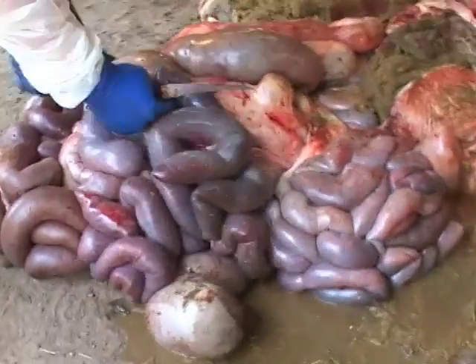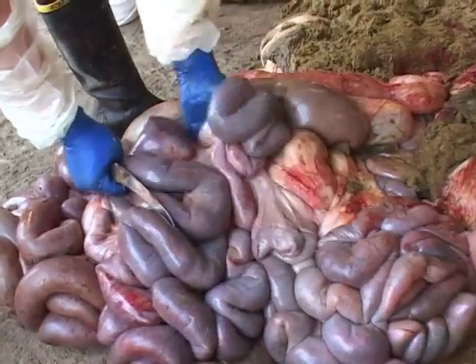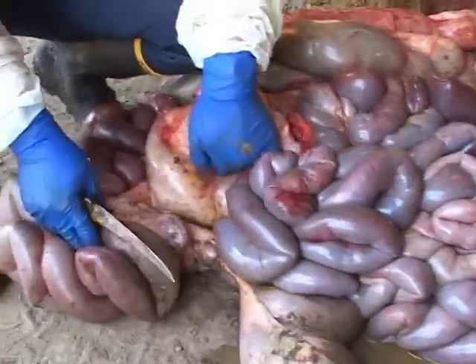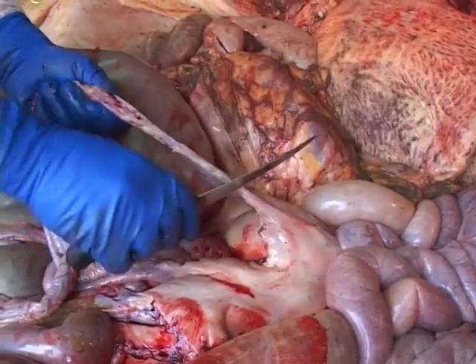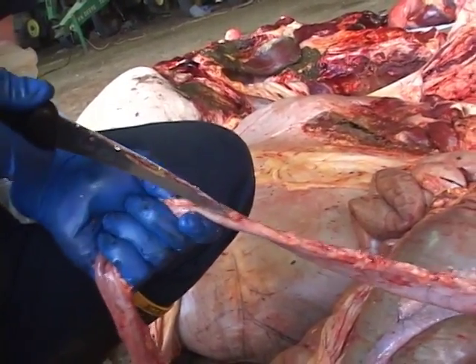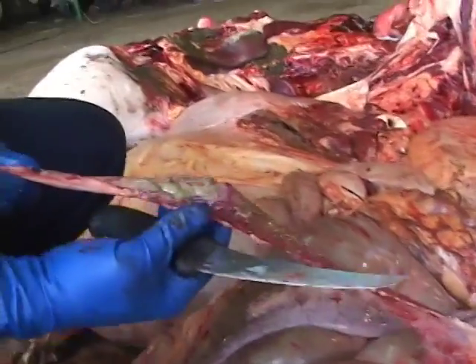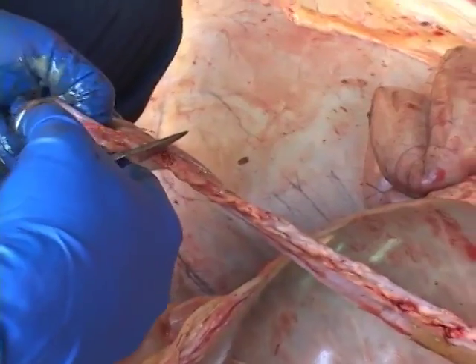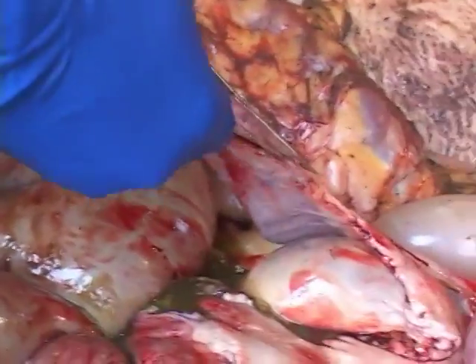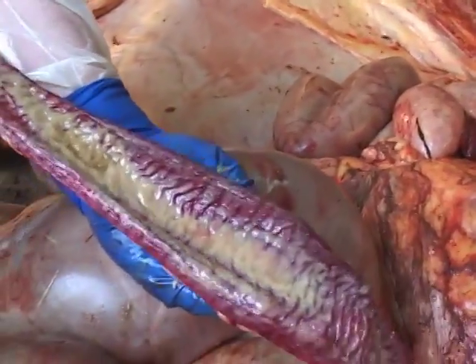Continue with a general inspection of the outer surface of the intestines, looking for any evidence of lesions. The mucosal surface of the bowel should also be inspected, along random sections or at any specific areas which appear suspicious for disease. Using the knife, separate a section of intestine from the mesentery. Place tension on the intestine and insert the knife into the lumen. With the sharpened edge of the knife facing up, cut along the mesenteric side of the bowel to expose the mucosal surface. Alternatively, scissors can be used to open the bowel in a similar manner. Evert the lumen to expose the mucosa and inspect the surface.